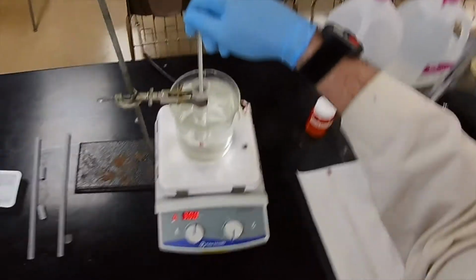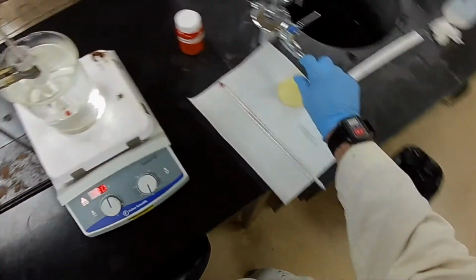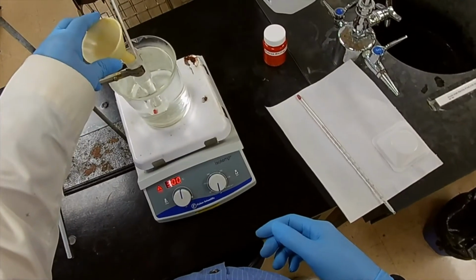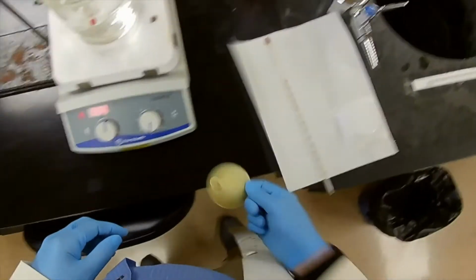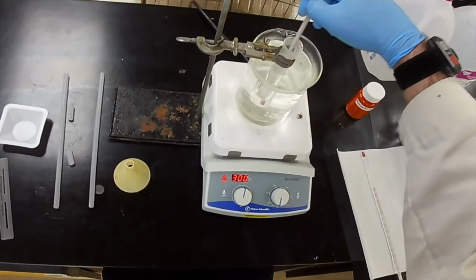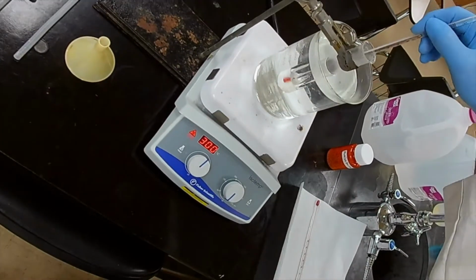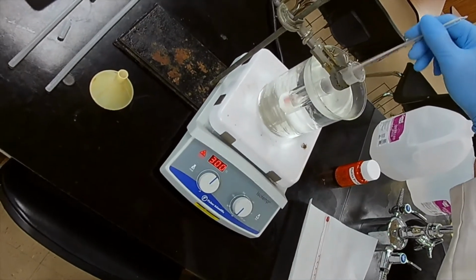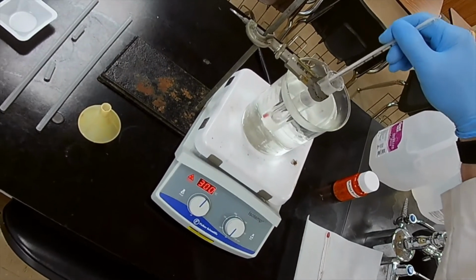Now, why do we have to take the thermometer out of there? I mean, it's just going to heat it again, right? Well, let me demonstrate. That doesn't work very well, does it? There's not room in there for the funnel and the thermometer both. So we're sort of forced to take the thermometer out. But I don't like to wipe off any of that material because that introduces an experimental error.